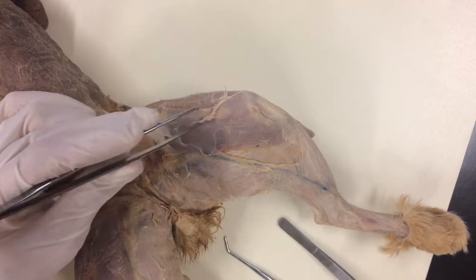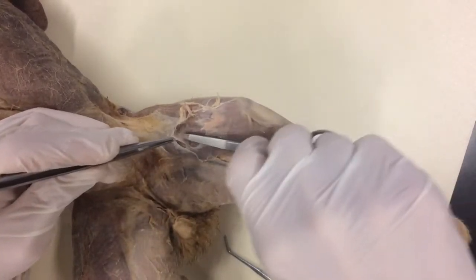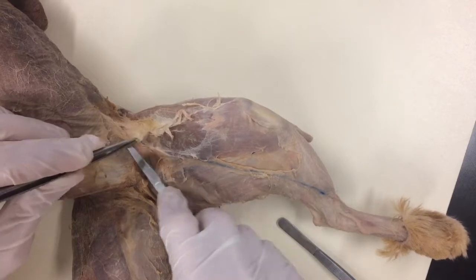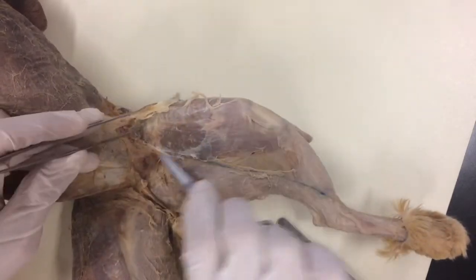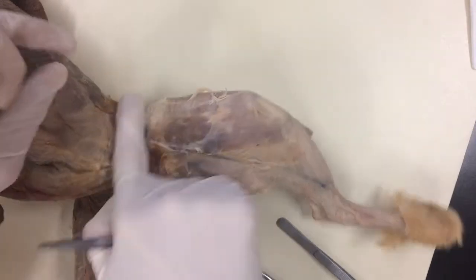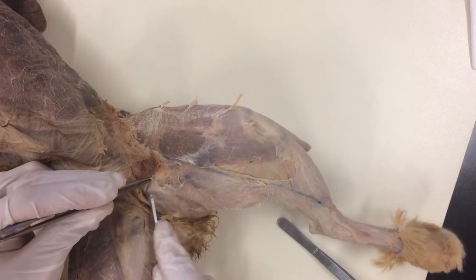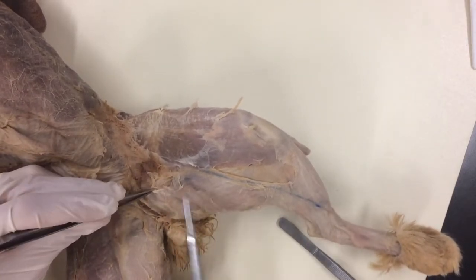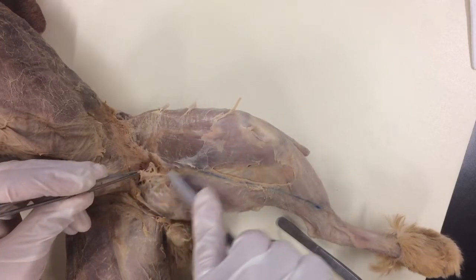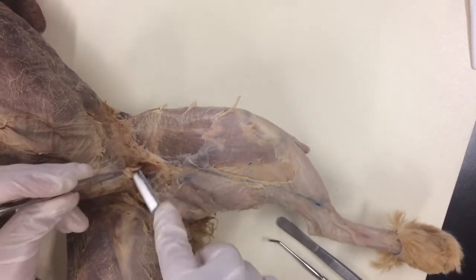We've got a little bit of connective tissue — it should not have a whole lot. If you do, clean that off first. I'm just going to go ahead and peel this little layer off. Now be careful in there; there's a lot of blood vessels and nerves right here in the triangle. I'm just going to work down until I get to the muscle, and I'll clean that area out later. I'm going to use my probe for this. Here's the edge of the muscle right there. I'm just taking that little piece of connective tissue right off the top so it won't damage any blood vessels.